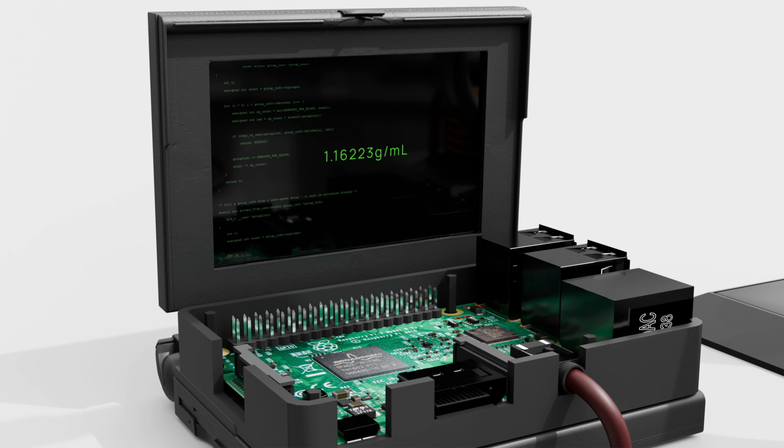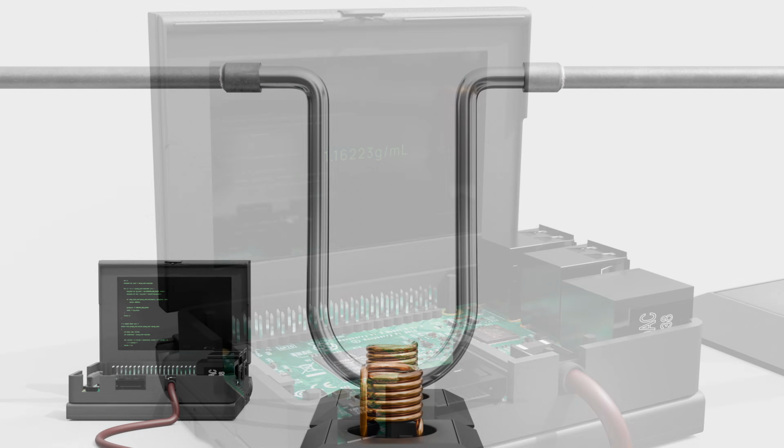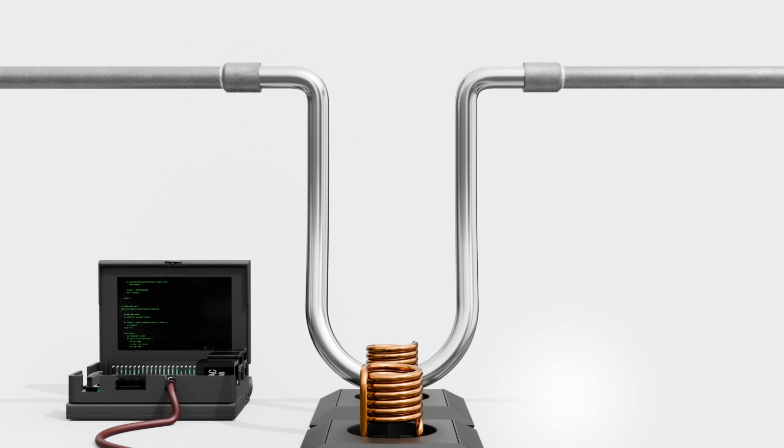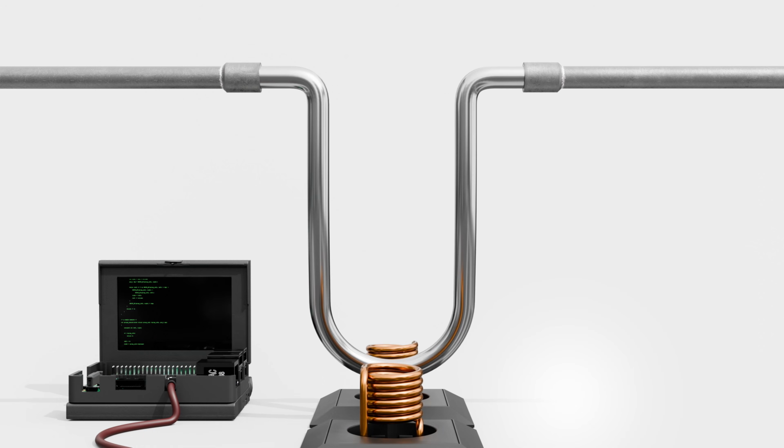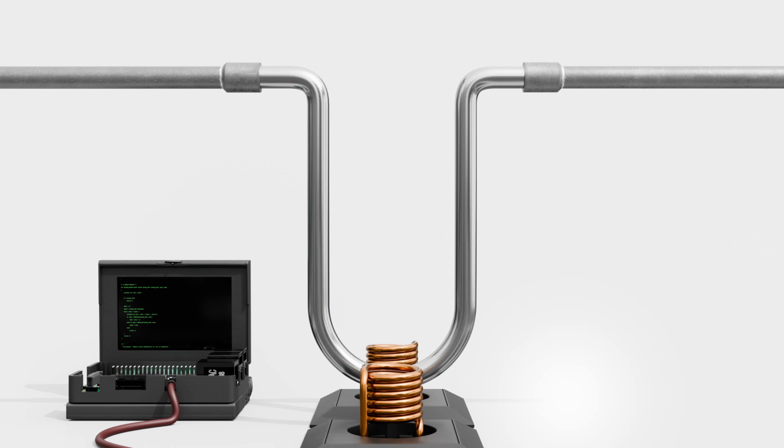These are awesome devices, and they are also so expensive as to be completely inaccessible to the amateur. Nonetheless, I want you to know that they exist. They save so much time that if you're measuring 500 samples an hour at your job, you'll probably hold your boss hostage until they get one or replace the broken one. Not that I would know anything about that.